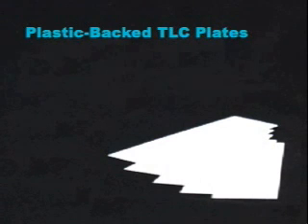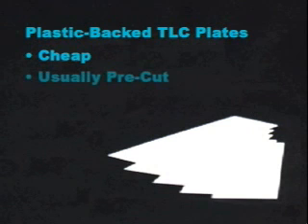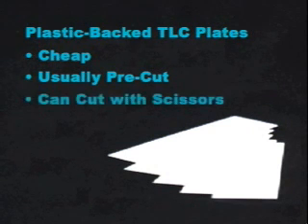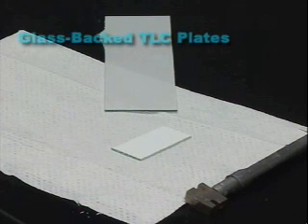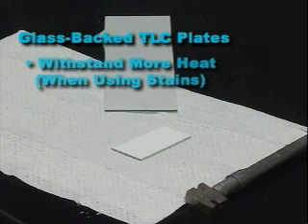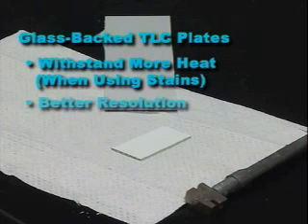Plastic-backed TLC plates, such as those used in the basic video, are found in many laboratories because they are cheap, usually pre-cut into a usable size, and if not, easy to cut with scissors. In spite of these conveniences, many chemists prefer glass-backed TLC plates. They can withstand more heat than a plastic-backed plate, which is important when you are using stains to visualize spots. They also frequently offer better resolution.